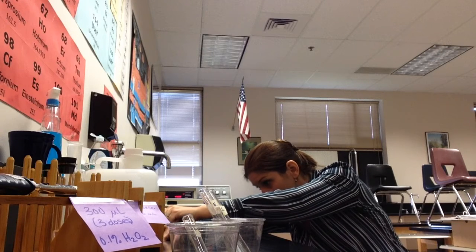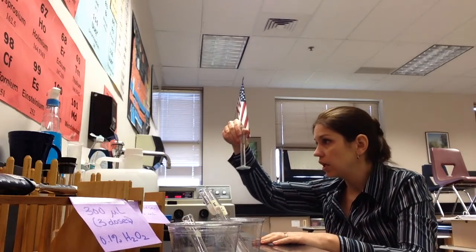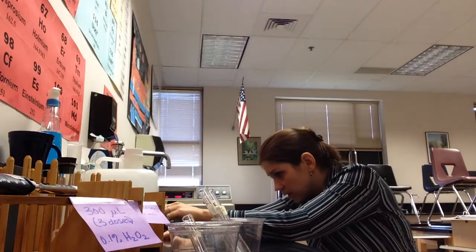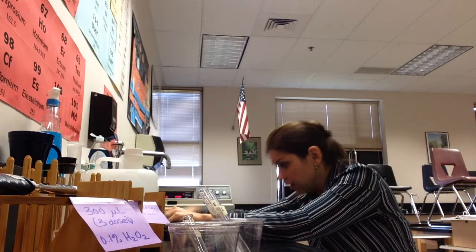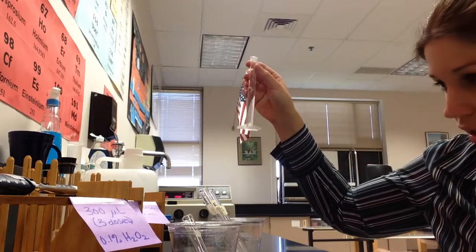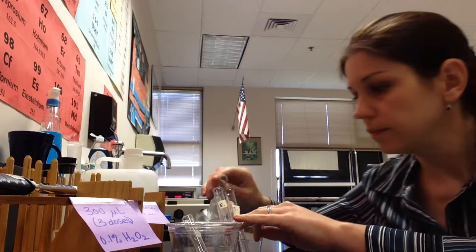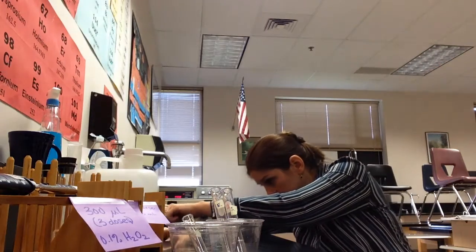Very often, as you guys know, I tell you that you don't need to be precise in biology, but this is one of those times when you need to do it properly. And so right on down to the last drop, if you want to get a dropper, in order to make sure that you do it properly, you can. I've got 7 mils, that's going to go in my substrate tube. You guys are going to actually have test tube racks, not cups, because I don't want these to fall over. And then I'm going to get 6 mils for my enzyme tube.